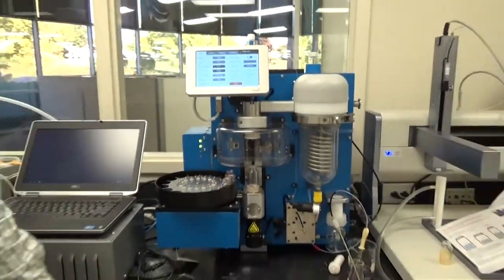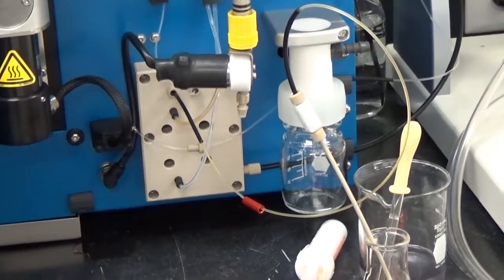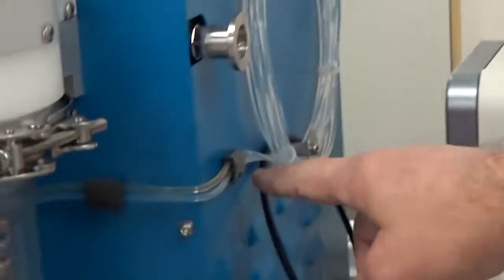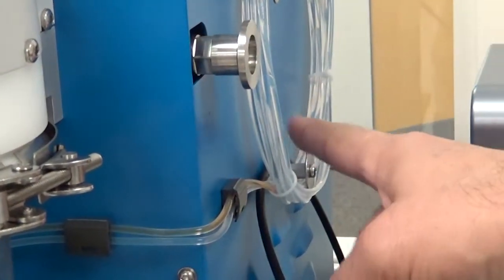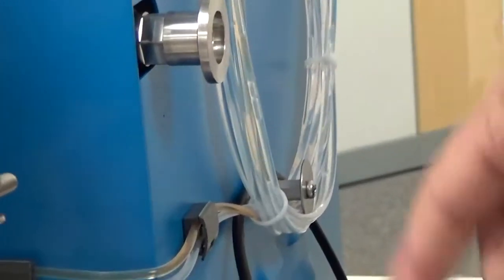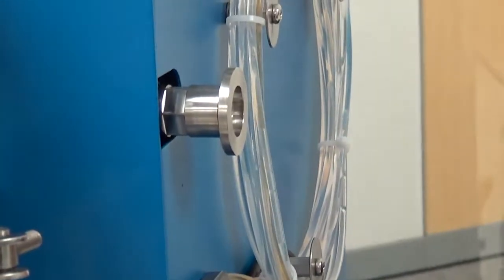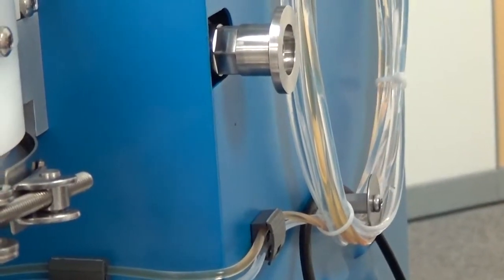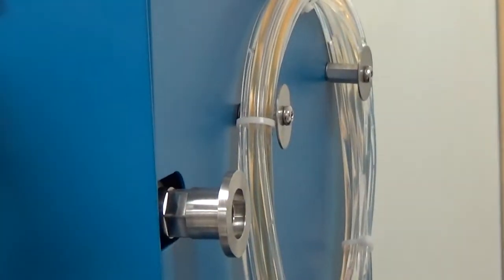If you watch here, there's a number of things going on. If you see how the solvent is coming up into this area. And if you come over to this side and zoom in on this tubing, you can see that it's drawing the contents of my reaction flask into this tube here. You can see it coming around. There's air bubbles in the line. That's normal. We actually want some air bubbles in there because it helps to clean the line as it's running. So right now it's filling that up and it's going to draw about 8 mils out of the vial here, because that's how much can be delivered.